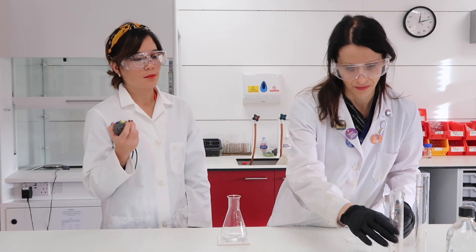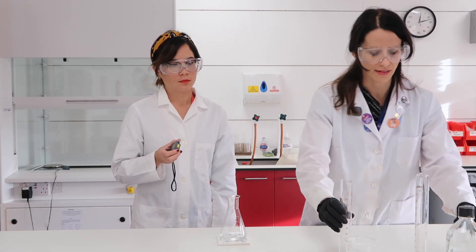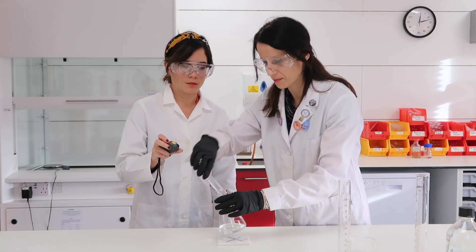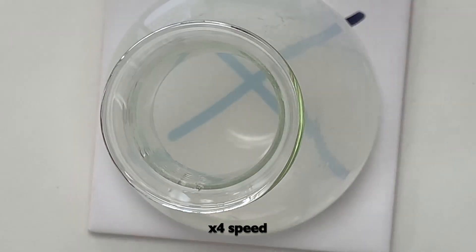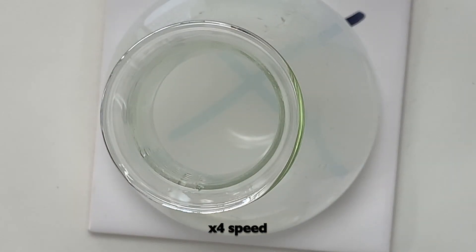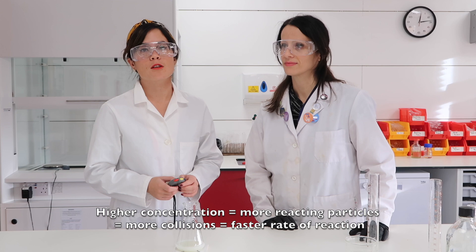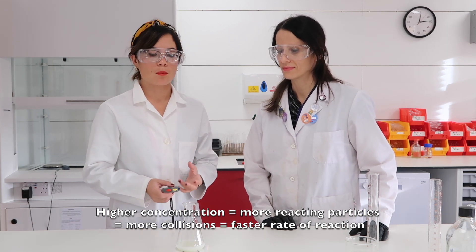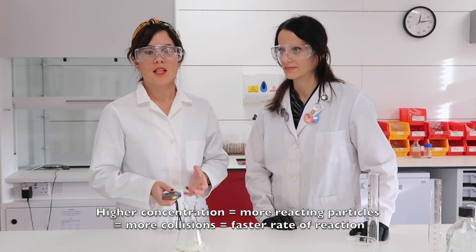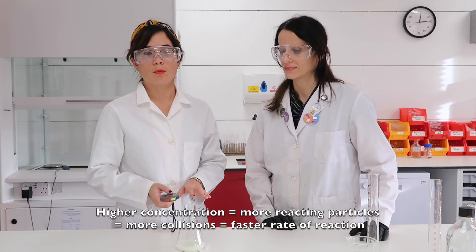I'm ready with my timer. As soon as we add the acid, we start the time. That reaction occurred super quickly — the cross was obscured at 36 seconds, so much quicker than the lower concentration, just as we would have expected. That's due to there being more reactive particles in the same volume, meaning far more collisions are occurring, and that's why we see the sulfur forming so quickly.